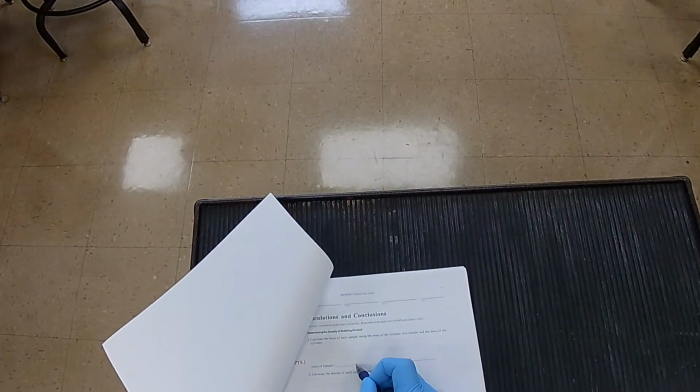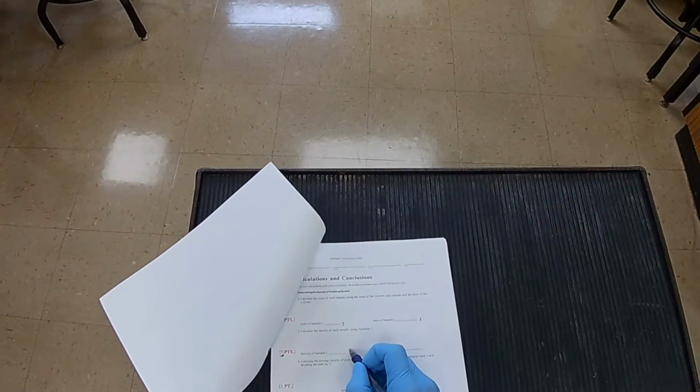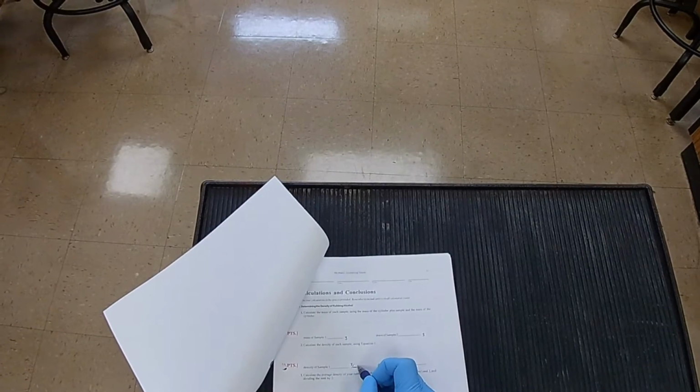Now, what does this one not have? This one does not tell you what the units are. The units are going to be grams because we measured in grams. How about the units here? Grams per milliliter. Don't forget the units. If the units are not already written for you, you better put the units there, or your answer's half wrong.